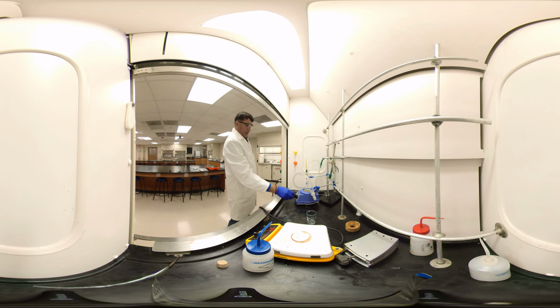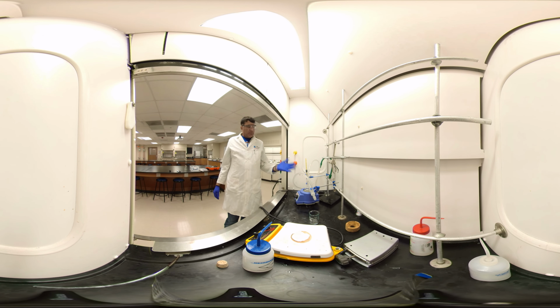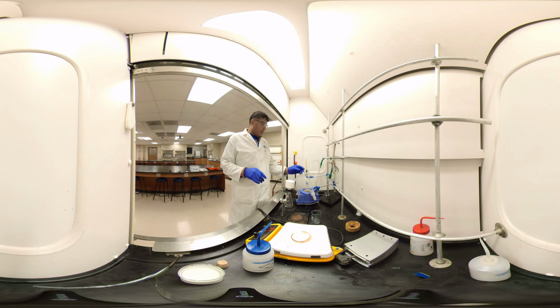Keep heating slowly because methylene chloride boils at 39.8 degrees centigrade, but benzyl alcohol at 205 degrees centigrade, so it does not come up. Keep heating until the temperature remains 40 degrees or all the dichloromethane is done. I'll continue from there. It's heating, okay. And while it's going with the reflux, you get it correct.